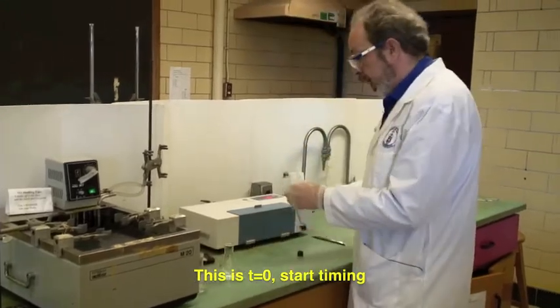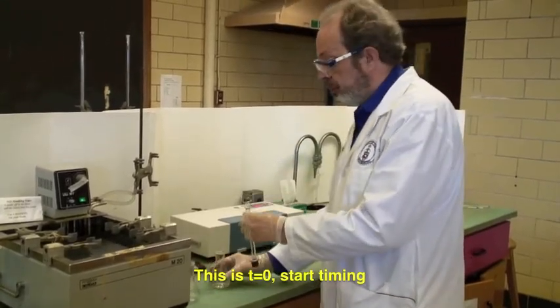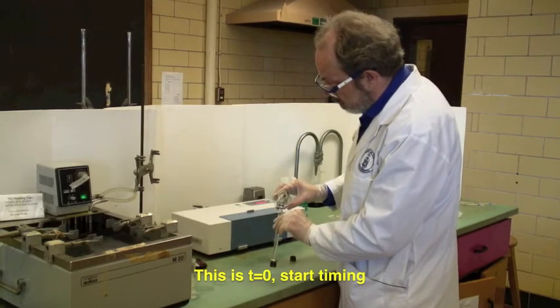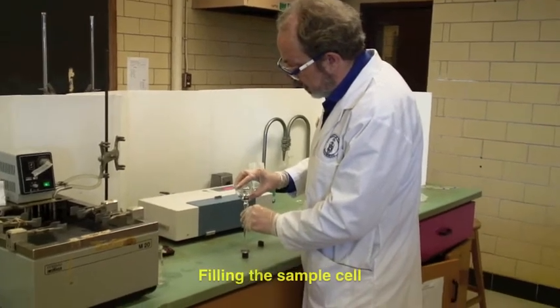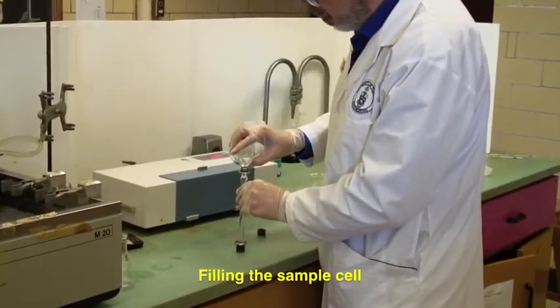Now at this point, I have to fill the cell. Take this and holding it vertically, pour your sample in.